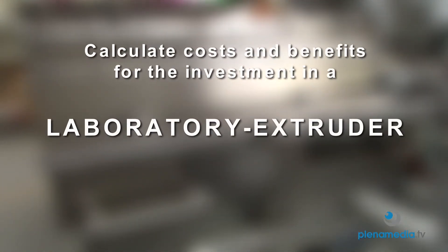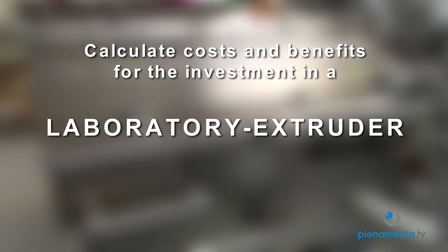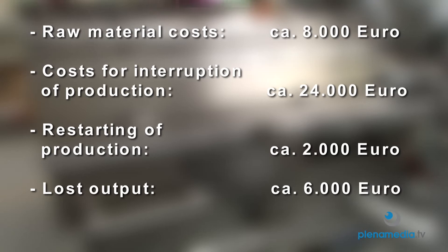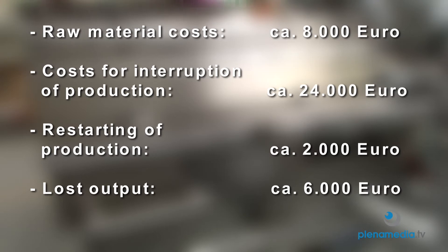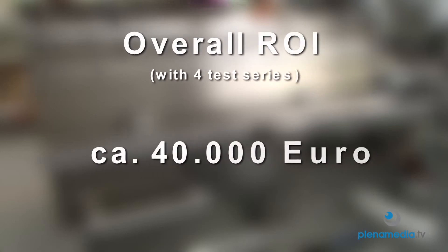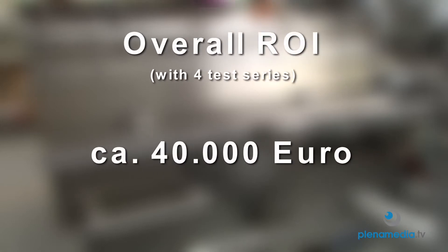Profit through savings of raw materials. Profit through abolition of production interruption. No additional cost for reconstruction of the production line. No cost through production downtime. In total, the return of investment — ROI — is approximately 40,000 euros. Our instruments apply for quality analysis in labs of the R&D centers and also in the production line.